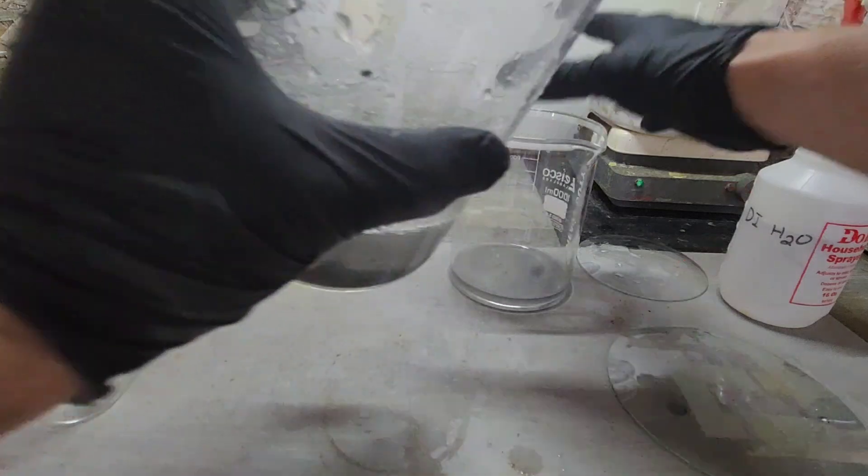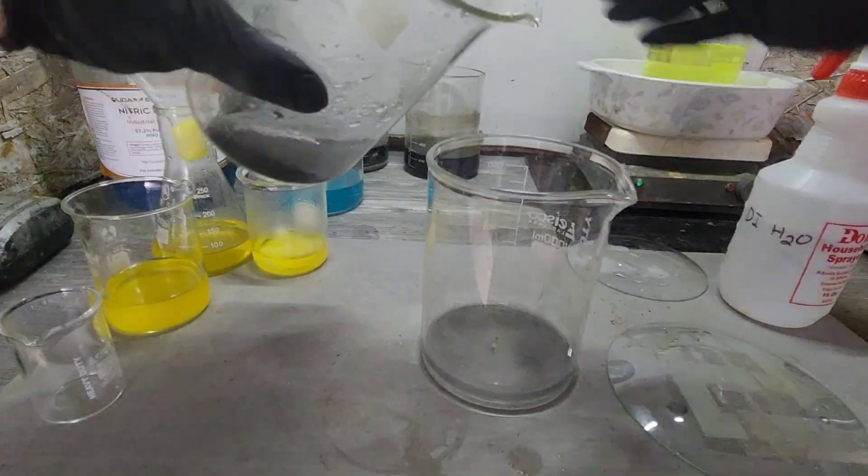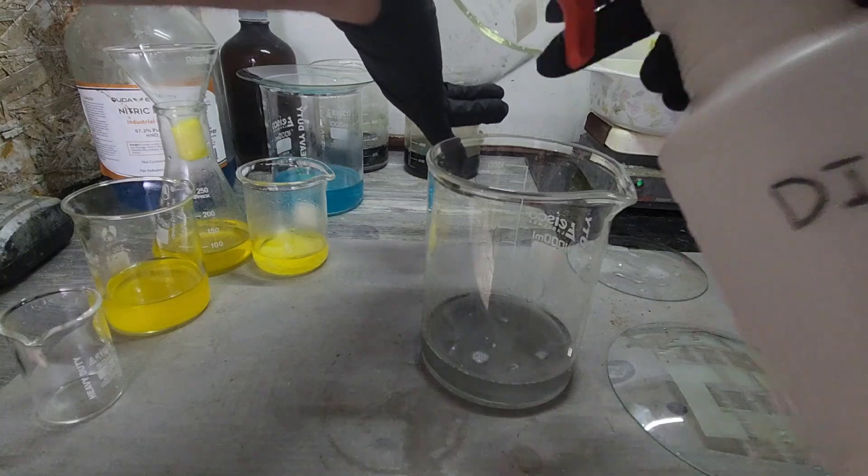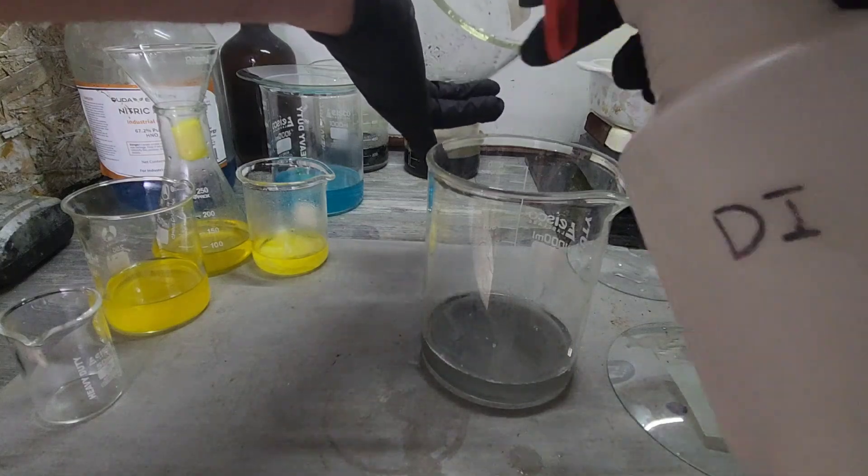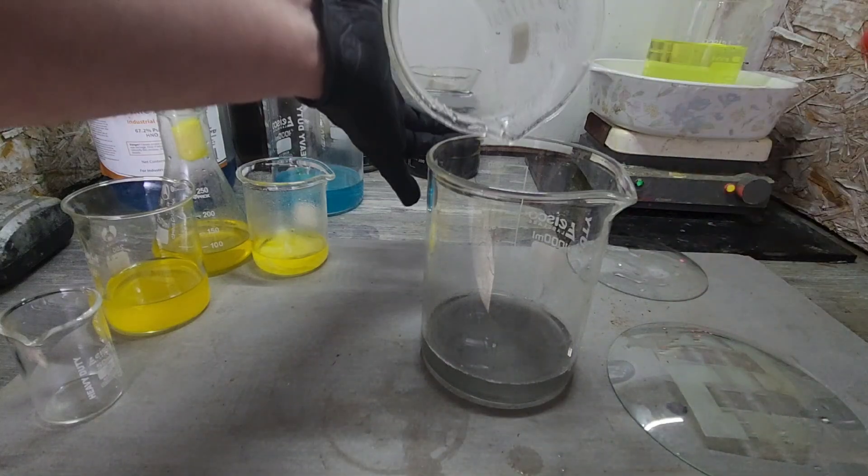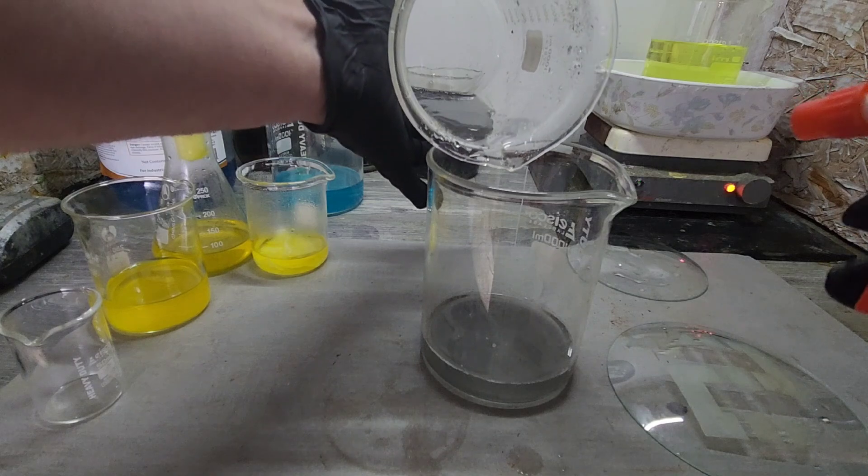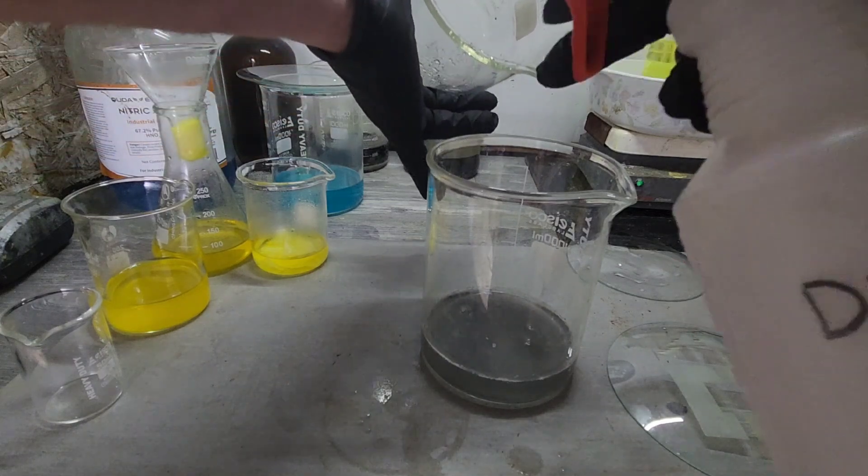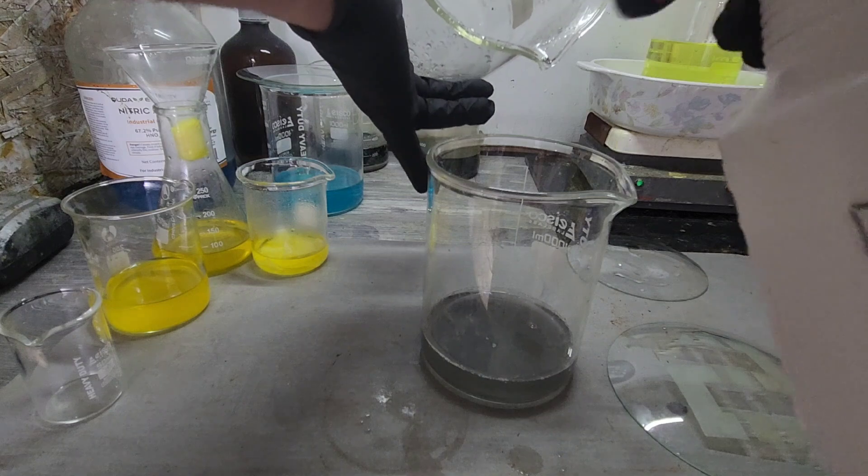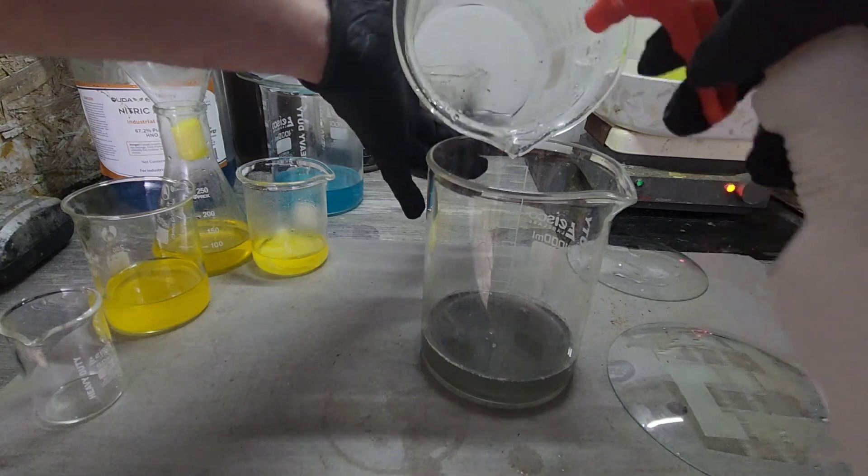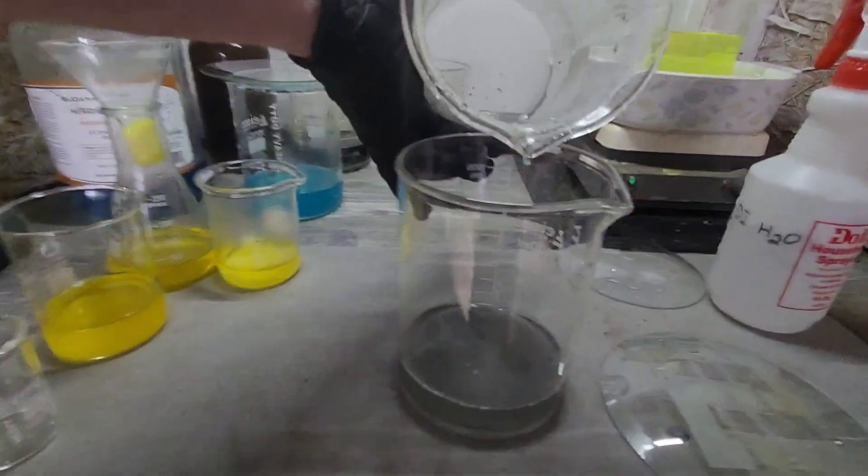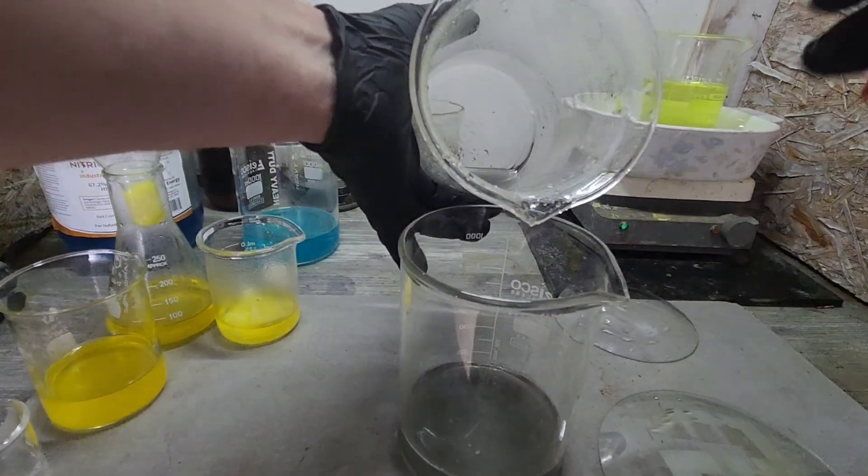I'm going to give this one more rinse here to see if we can get any of that leftover hydrochloric out. You can see it's already sticking together pretty well. Let me get you up in here a little bit, my bad guys.